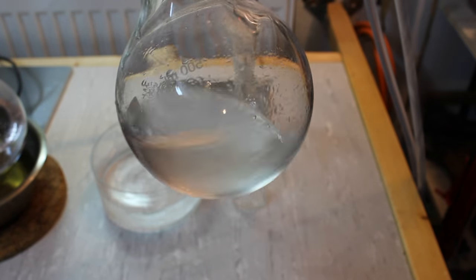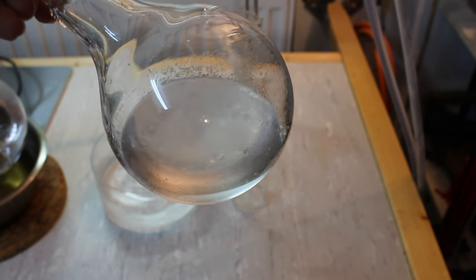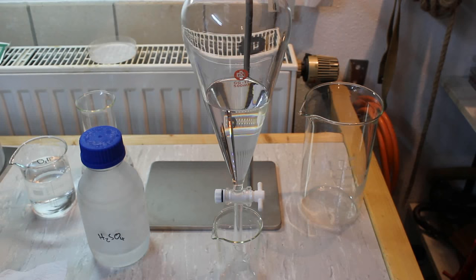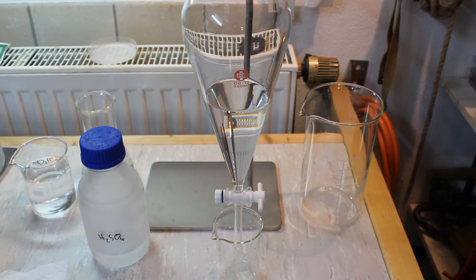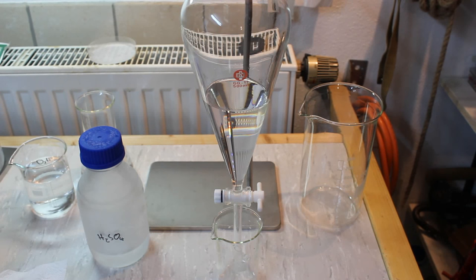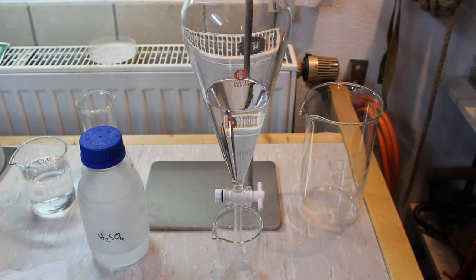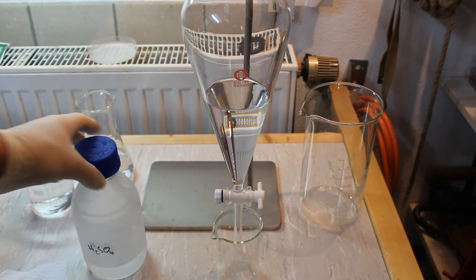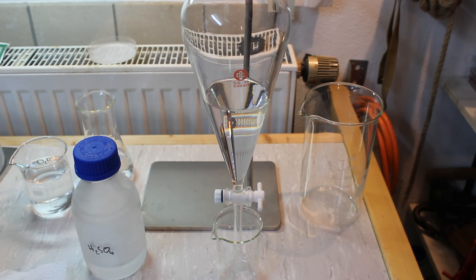Here is our yield of crude bromoethane. We are going to further purify it by first washing it and then later distilling it a second time. I have added all of our product into a separatory funnel and we are going to wash it a couple of times. First we are going to wash it with concentrated sulfuric acid two times — I have chilled this sulfuric acid in the freezer. This serves to remove any traces of ether that might have formed as a side product.